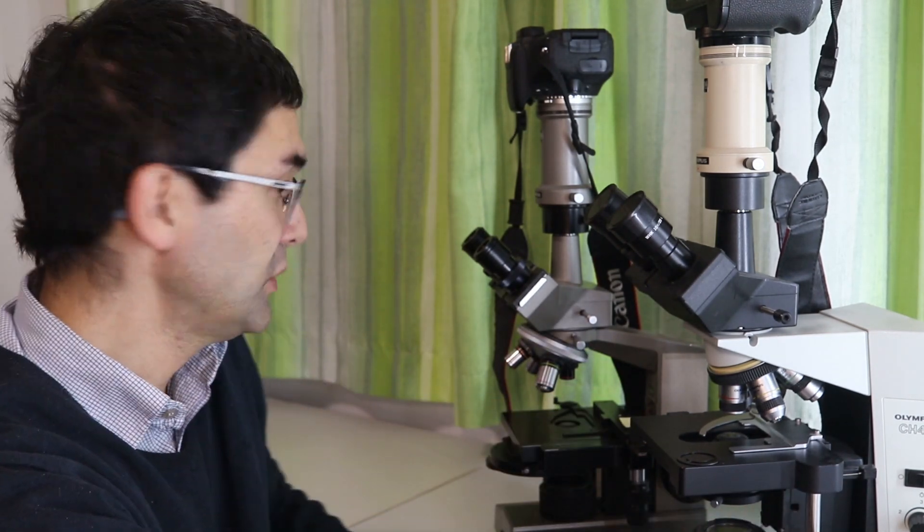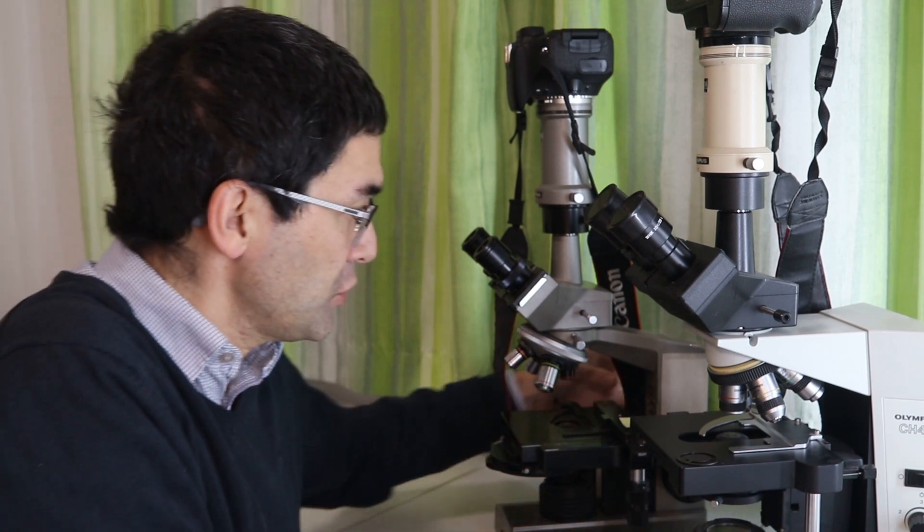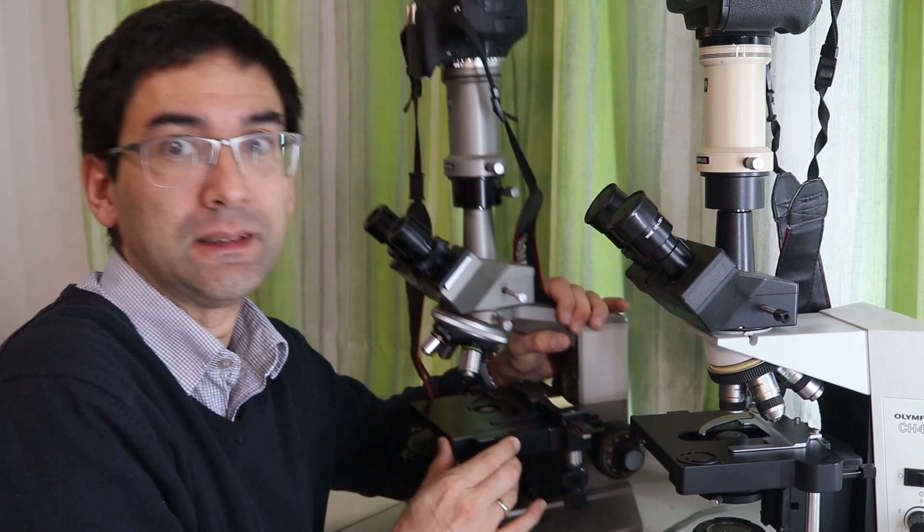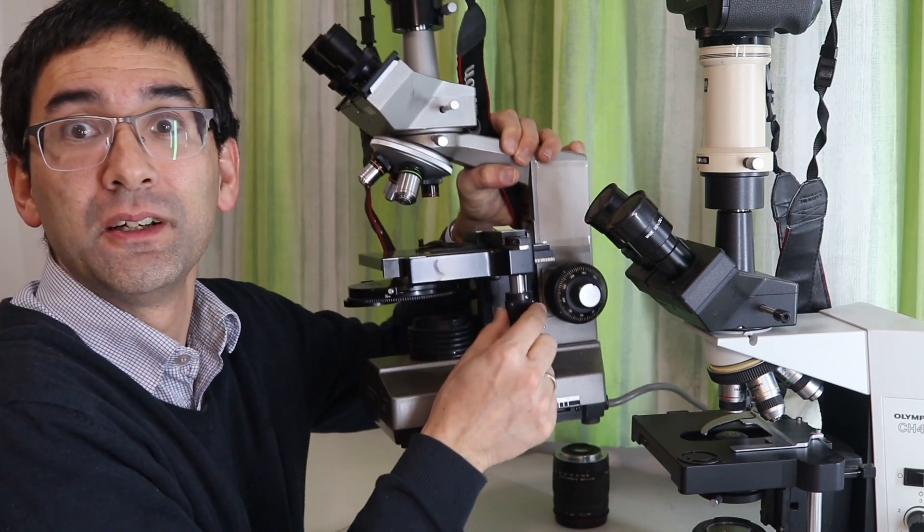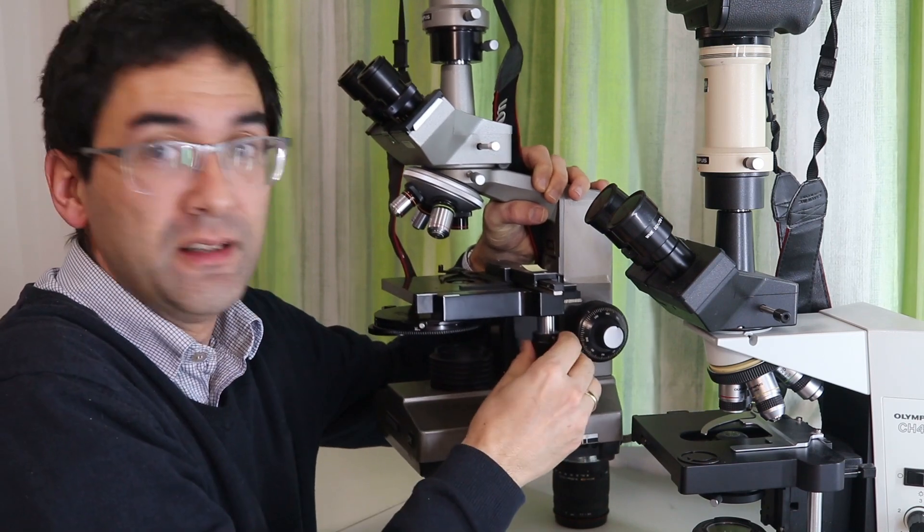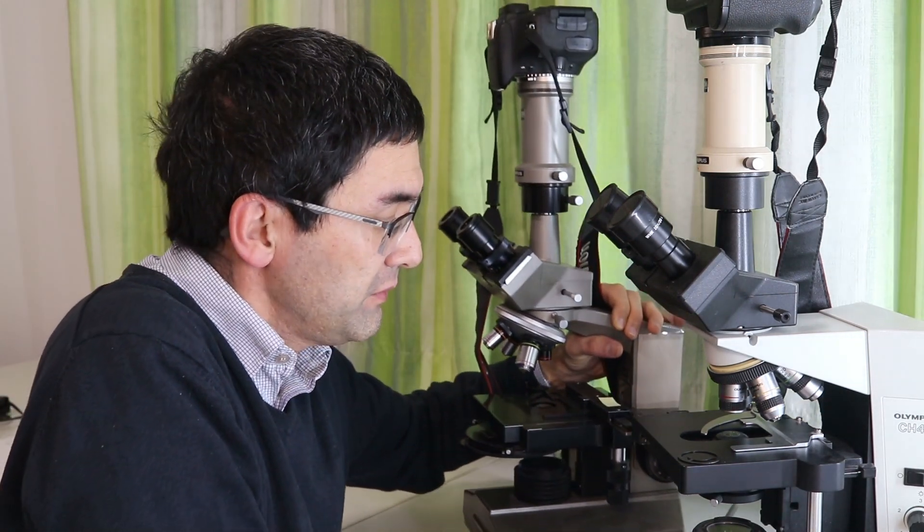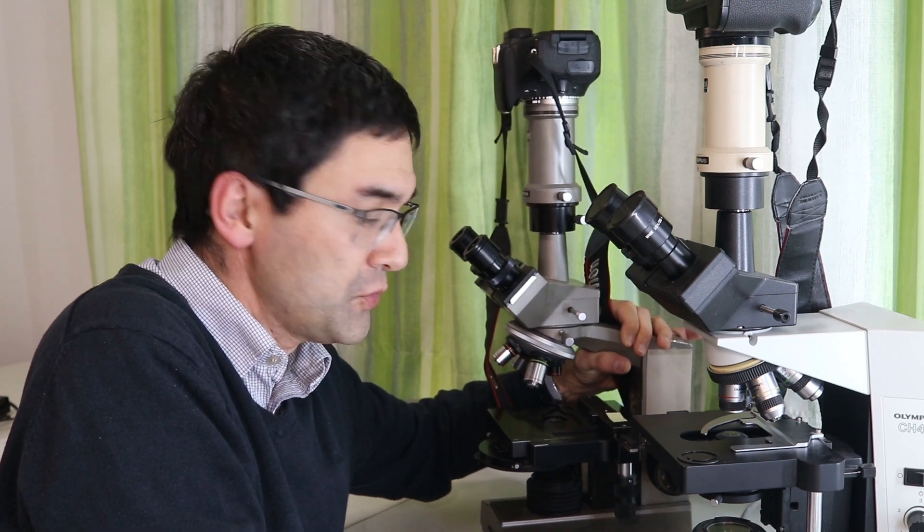Mechanical stage allows you, you cannot see this in here. How am I going to do this? I cannot even lift this heavy microscope here. I'm going to try it here. Look, this is not very good. Do you see this here? If I turn this, then I can actually move the slide. That's called a mechanical stage. That's not very good to lift a microscope like this.